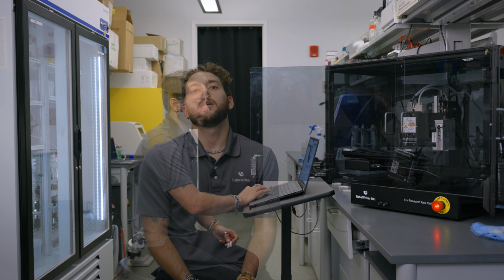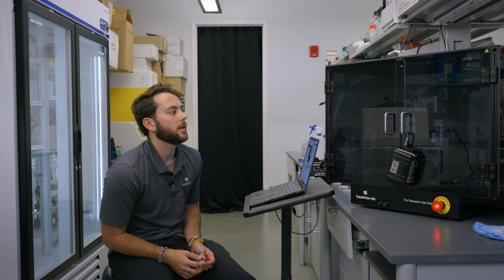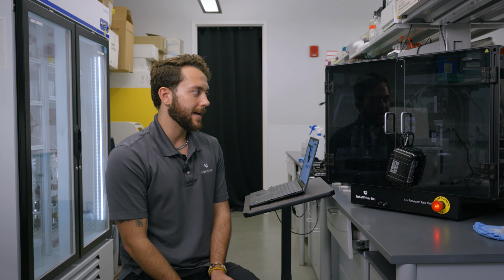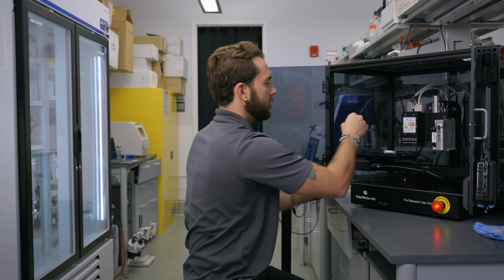Now I'm going to show you what to do if your print is too high or too low on the tube and the text is getting distorted. So I'll go ahead and print right now, and we'll check out the tubes and how they look so we can see what adjustments we need to make. So now the TubeWriter is going to go ahead and print that first tube and the last tube. So it's done printing. I'll go ahead and open up that safety cage and grab my tubes.